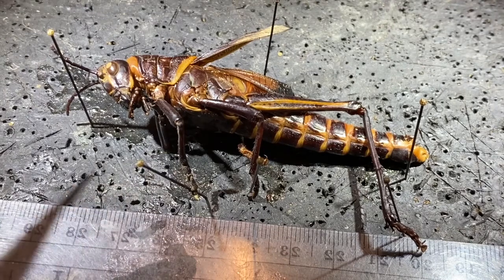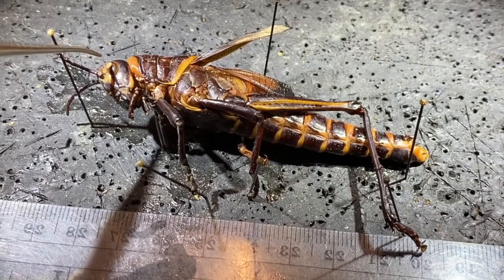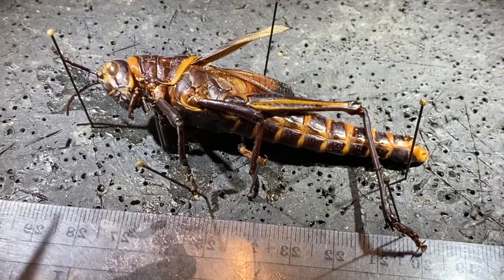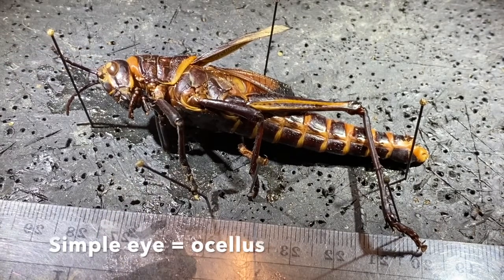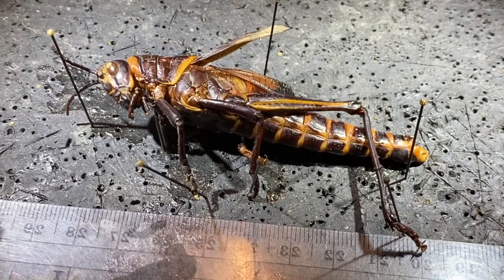So let's start with the head. One of the prominent features that we can see right here is the compound eye. These animals also have simple eyes. There's often one just between the antennae and a couple more up on the head in other locations. These animals have mandibles, and they use them to slice up the plant material that they eat.